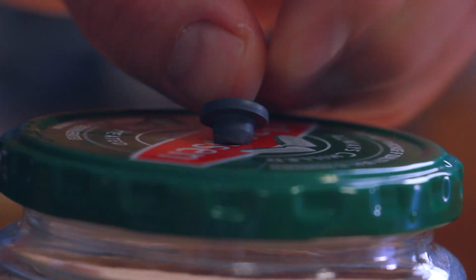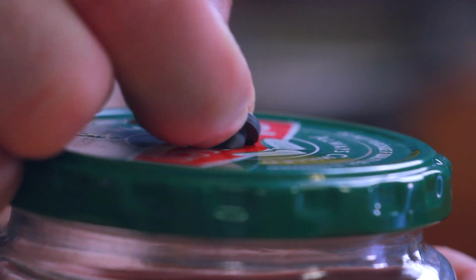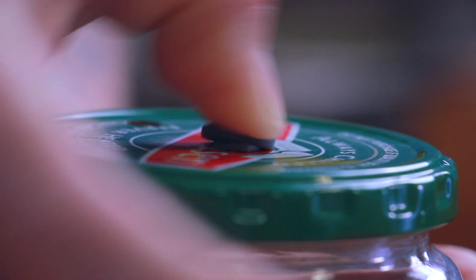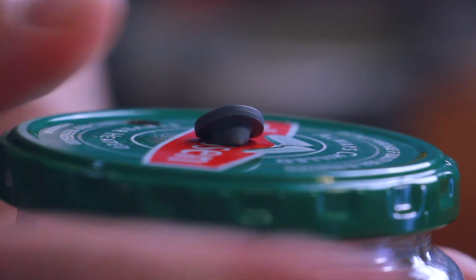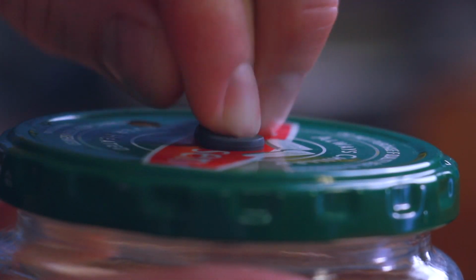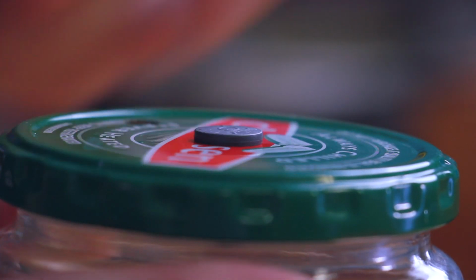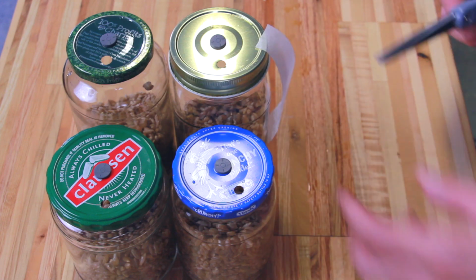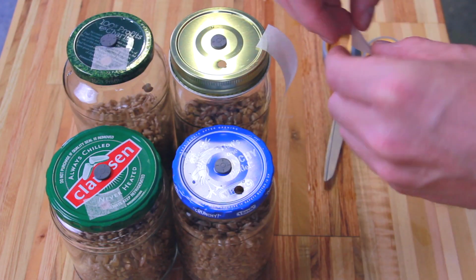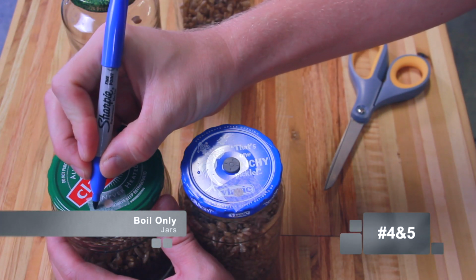Just want to give you all a quick view of how I install the plugs into the top of the lids. It's not super hard to do, but it does take a little bit of technique. You have to wiggle it in and squeeze the bottom part that penetrates through the lid. And then I give it a little twist on the way in, and that helps it seat pretty well. I'm covering each of the vent ports with micropore tape. This is a product from 3M, and it's what I use as the vent on all of my grain jars.